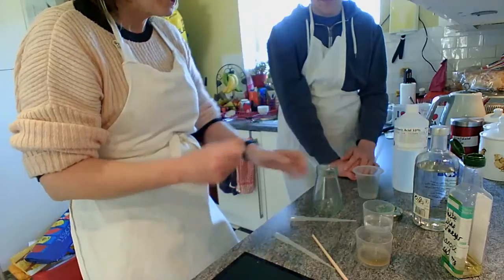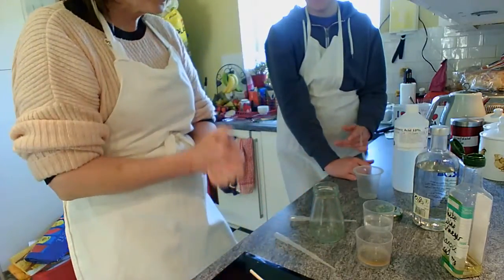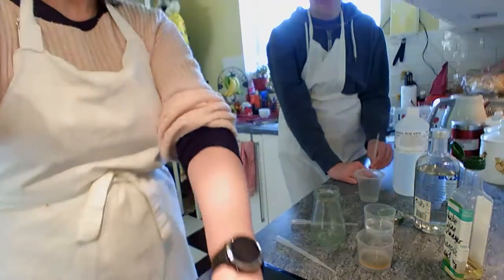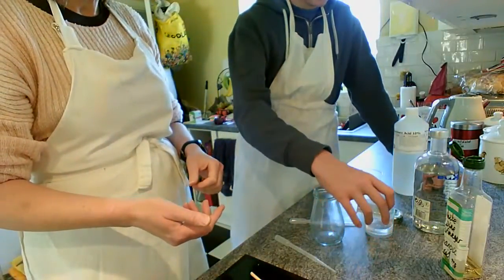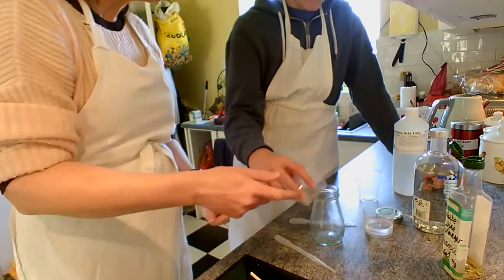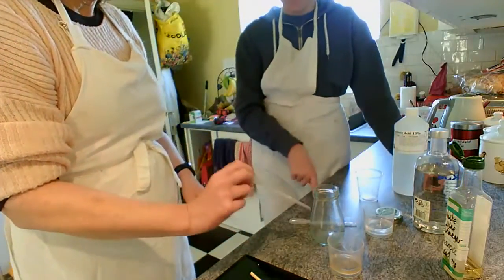Are you ready for this? I mean, they won't recognize it because they can't. No, you're going to have to describe what we've done. Okay, so you're going to have to describe this change in smells, which might be a little difficult because we've got the slow cooker on at the moment. No, we're going to mix it in the conical flask, and we were going to measure it using the pipettes, if you remember. It's fine, just wing it.